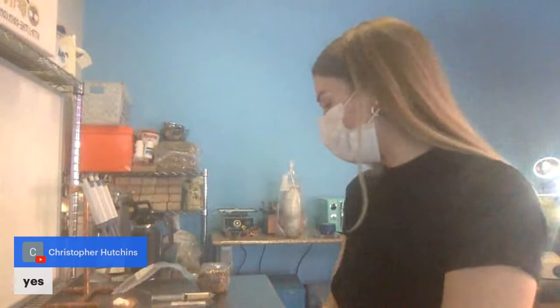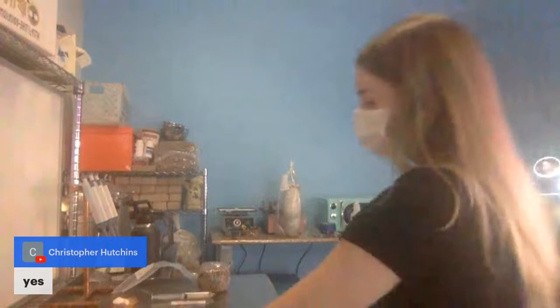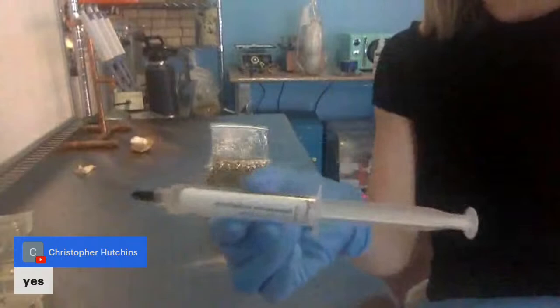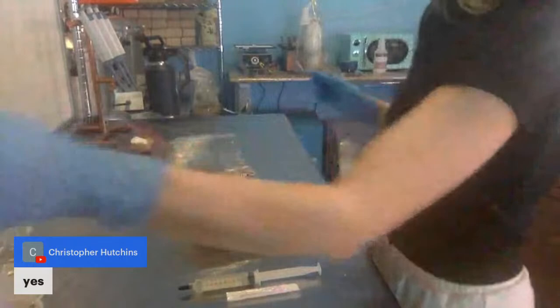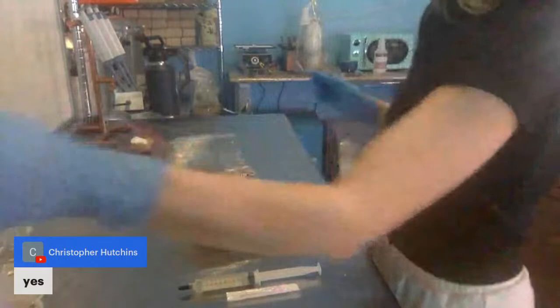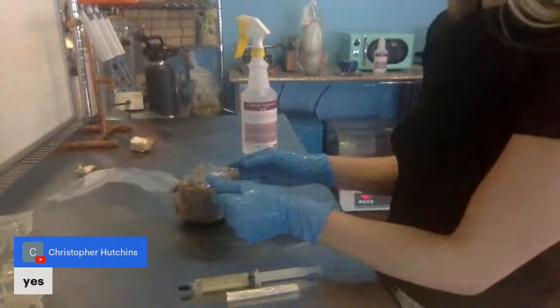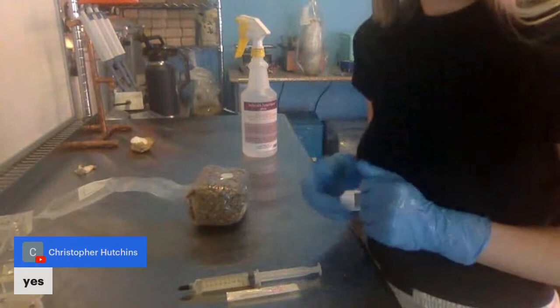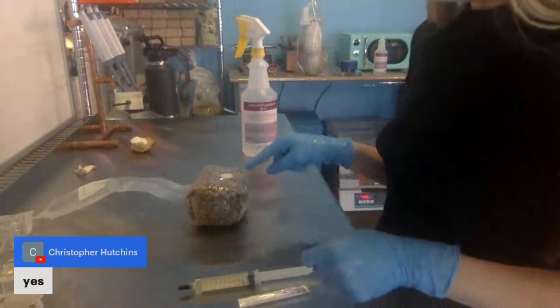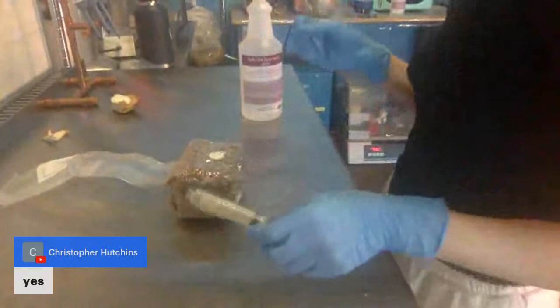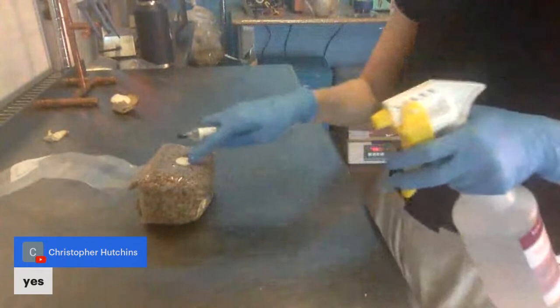So that's the cloning demo. Now I'm going to show you what to do with your syringes. This is what you got in your kit. You've got your syringe, you should have gotten the needle to go with it and four grain bags. This is really easy. It's not susceptible to contamination if you have some common sense. This comes sterile. This is sterile inside.